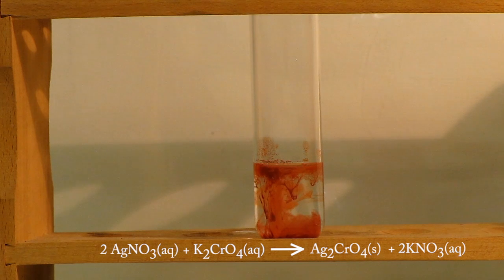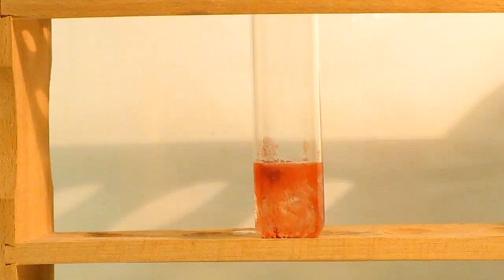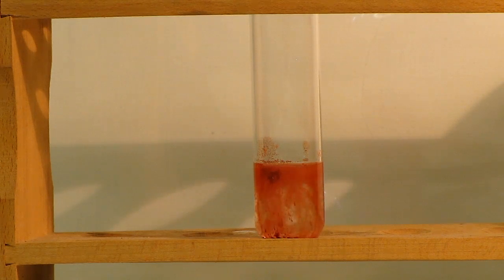Now I'm not sure, but I think precipitating means falling down, right? Yeah. Something just formed in there and fell down to the bottom. It precipitated. It was like rain.